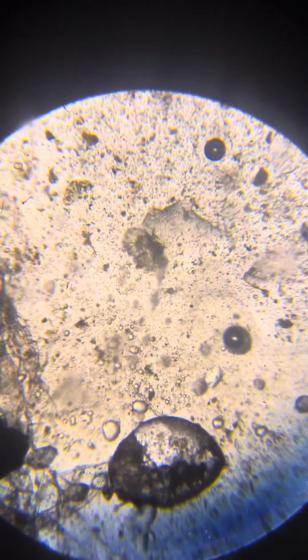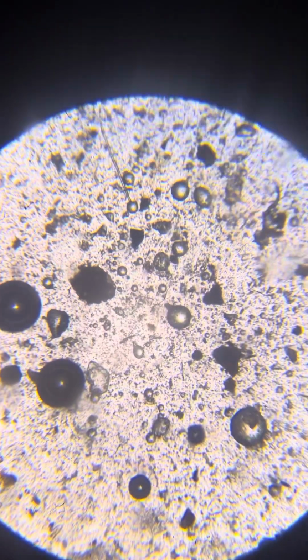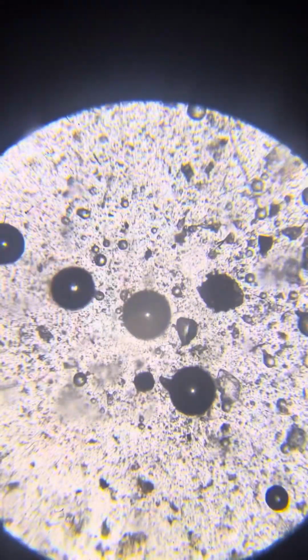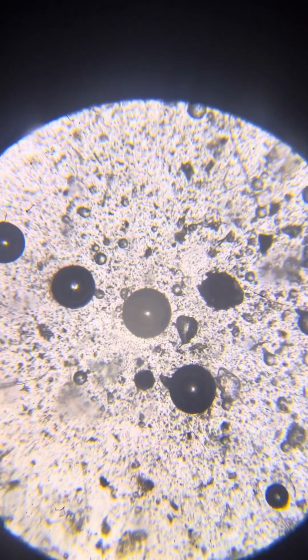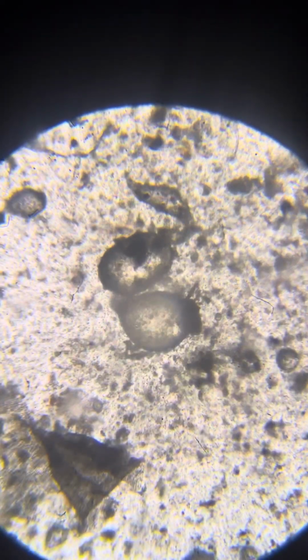Okay, nice. As to be expected, the main difference is that we don't see, of course, there are no dud ones here because it wasn't connected to electrolysis. This is what I call the ecological pathway, which means that they multiply and grow without an external source of energy, but using the mixture and things that I add from time to time, and we see the existence of all sorts of fatter ones that we didn't see in the other mixtures.